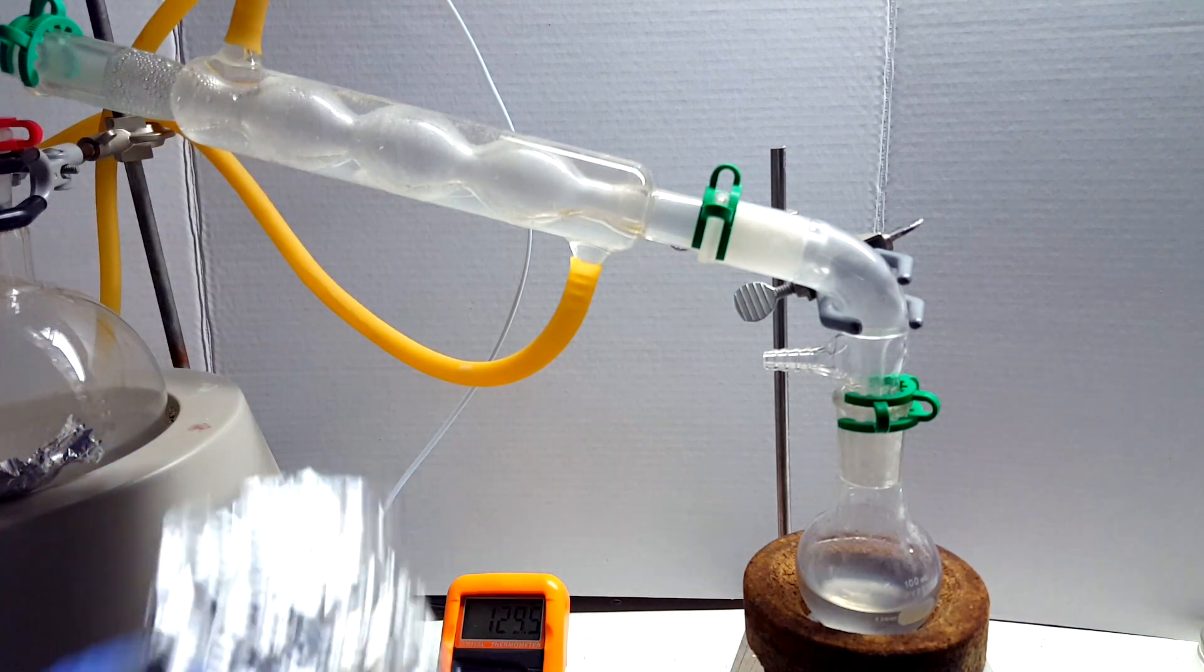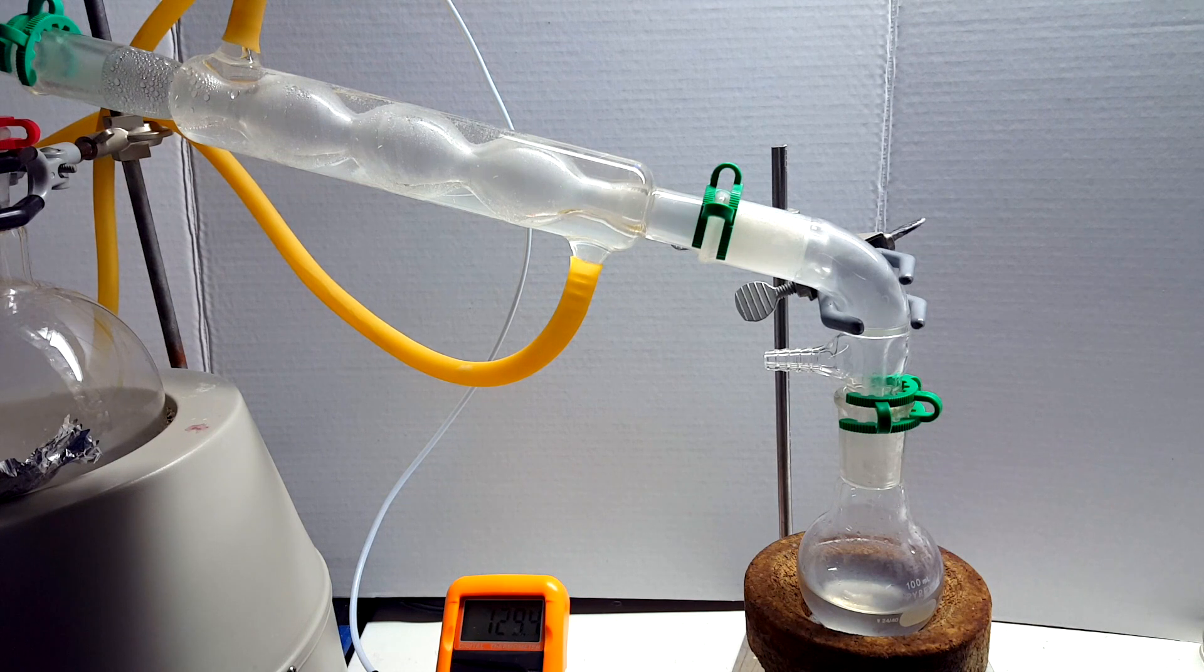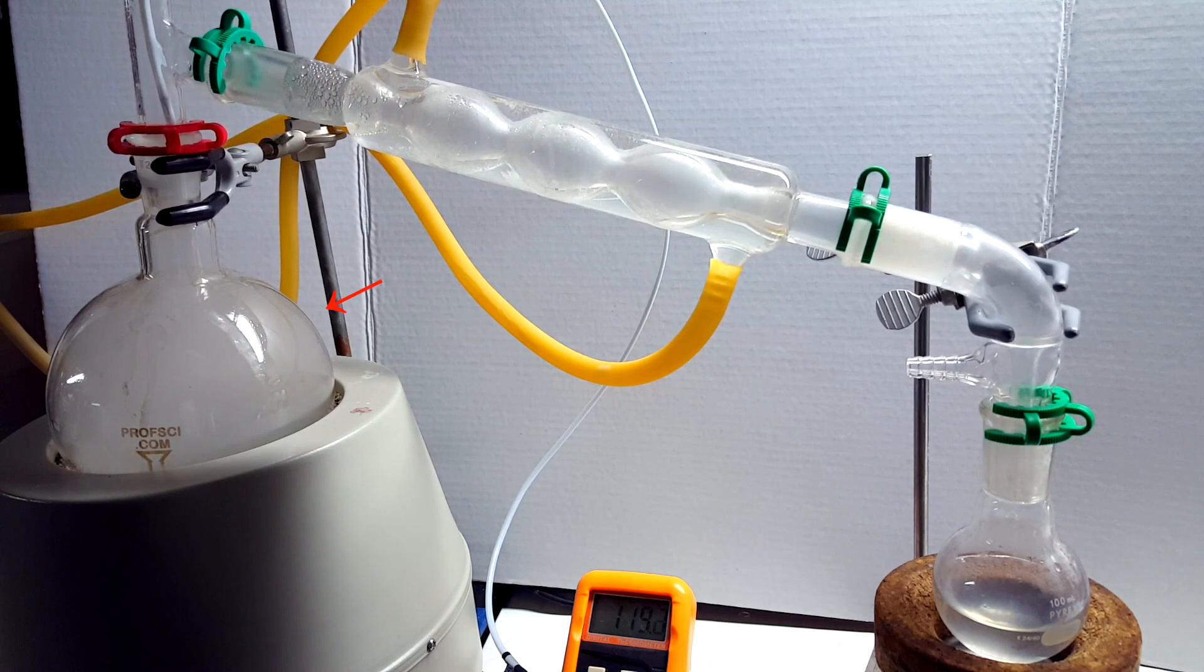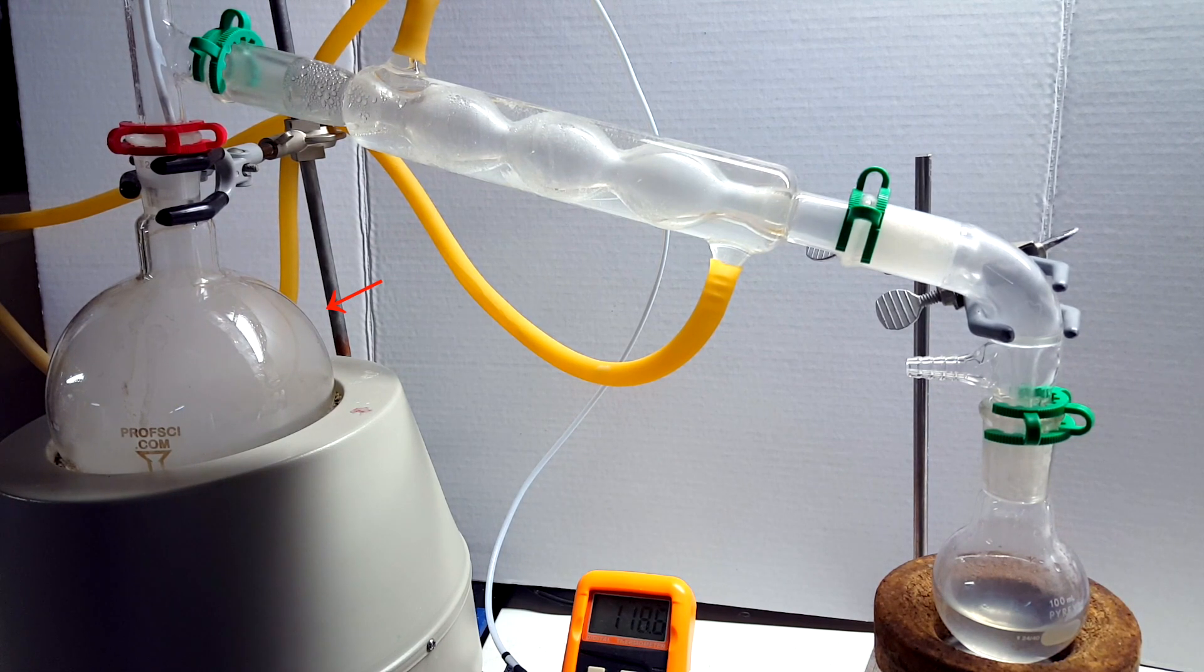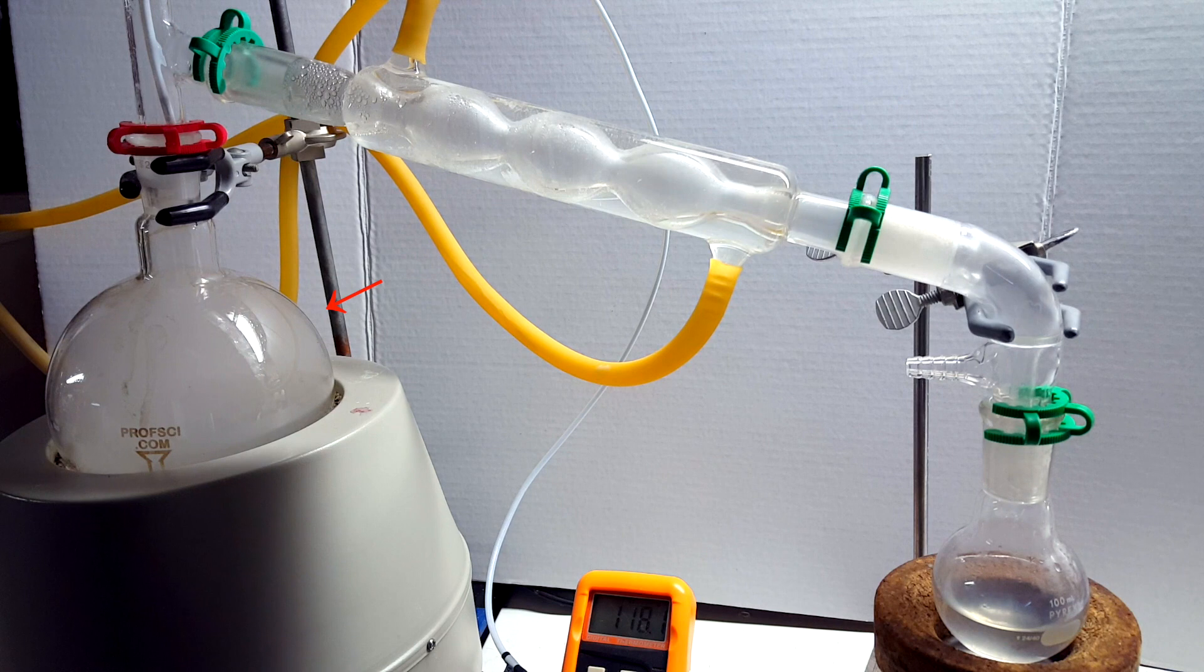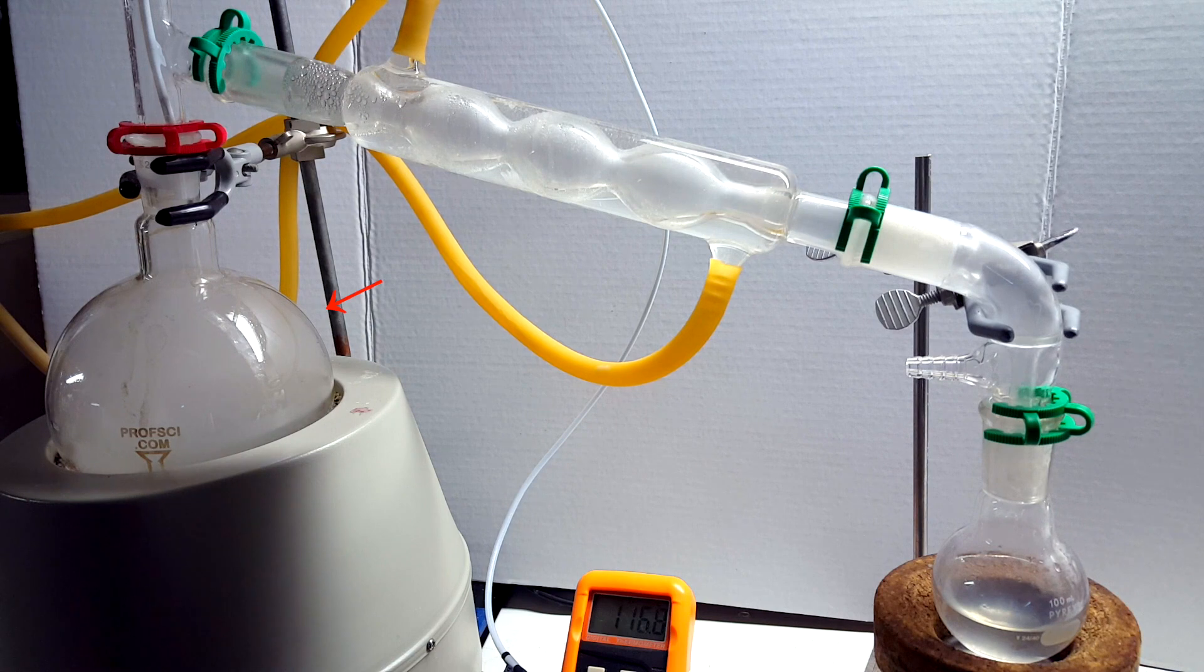However, the rate of increase was so slow, I decided to allow the apparatus to cool and change my setup a bit. Interestingly enough, when I took it off heating, the entire distilling flask filled with a thick smoke. I'm not entirely sure what caused this, because phosphoric acid derivatives tend not to be light sensitive to my knowledge.